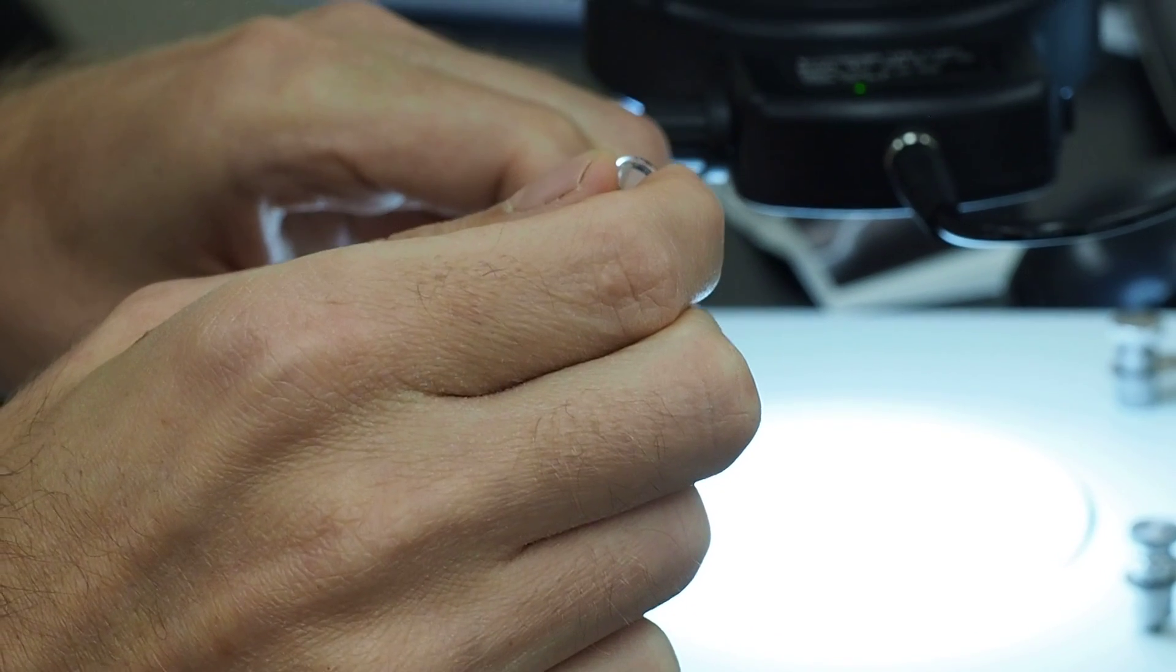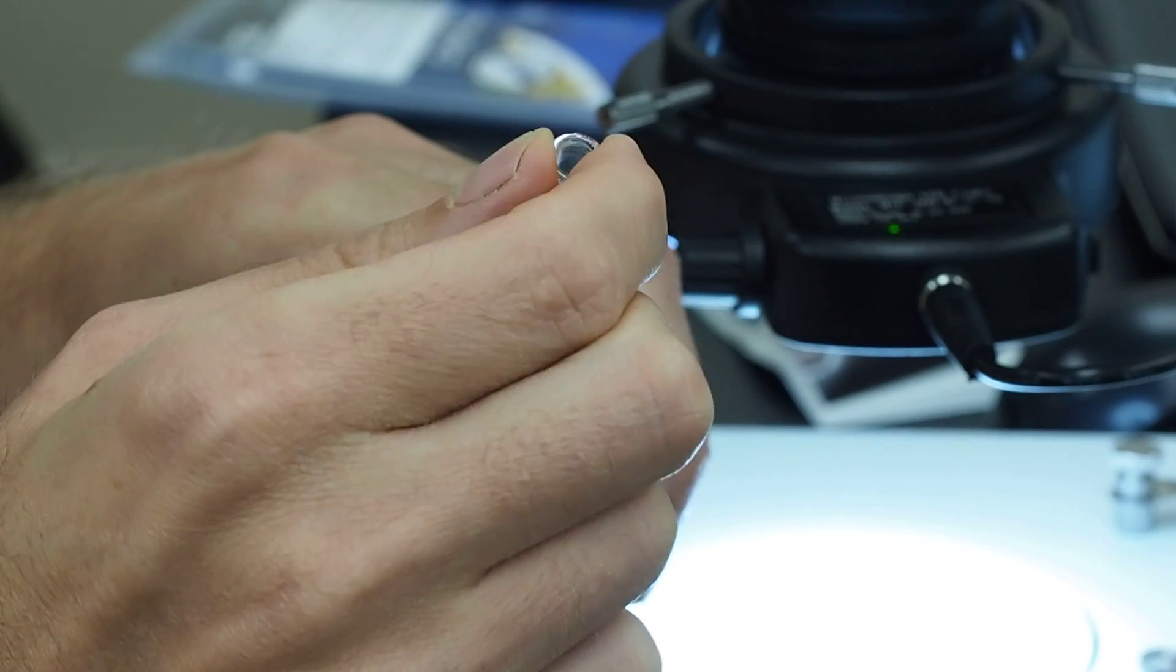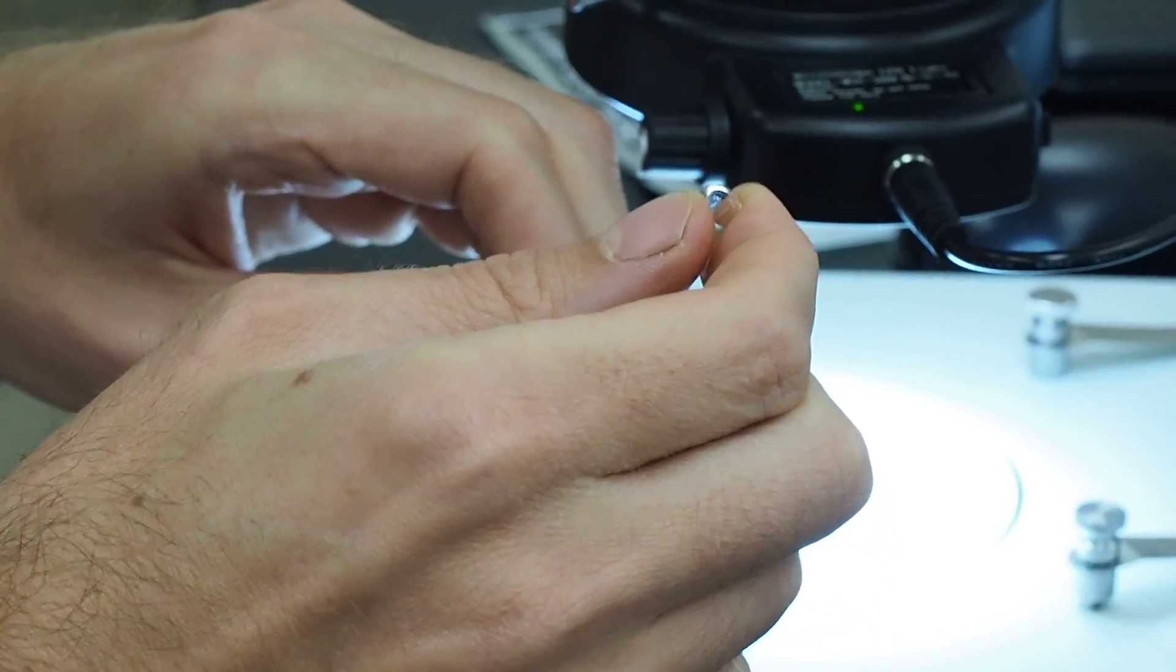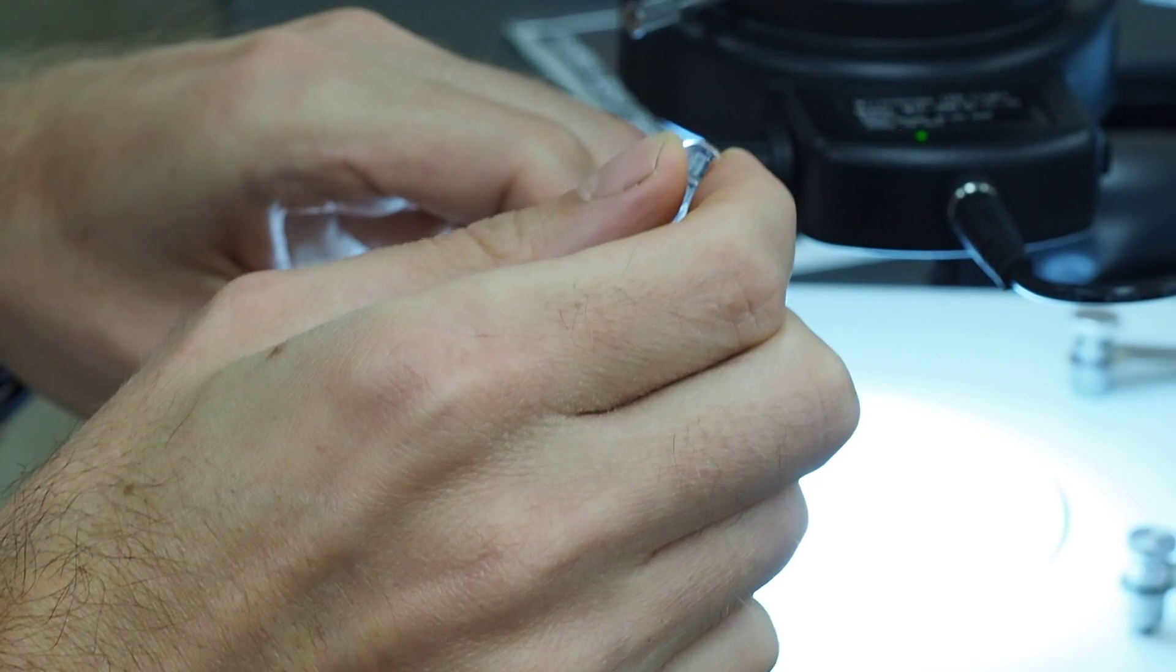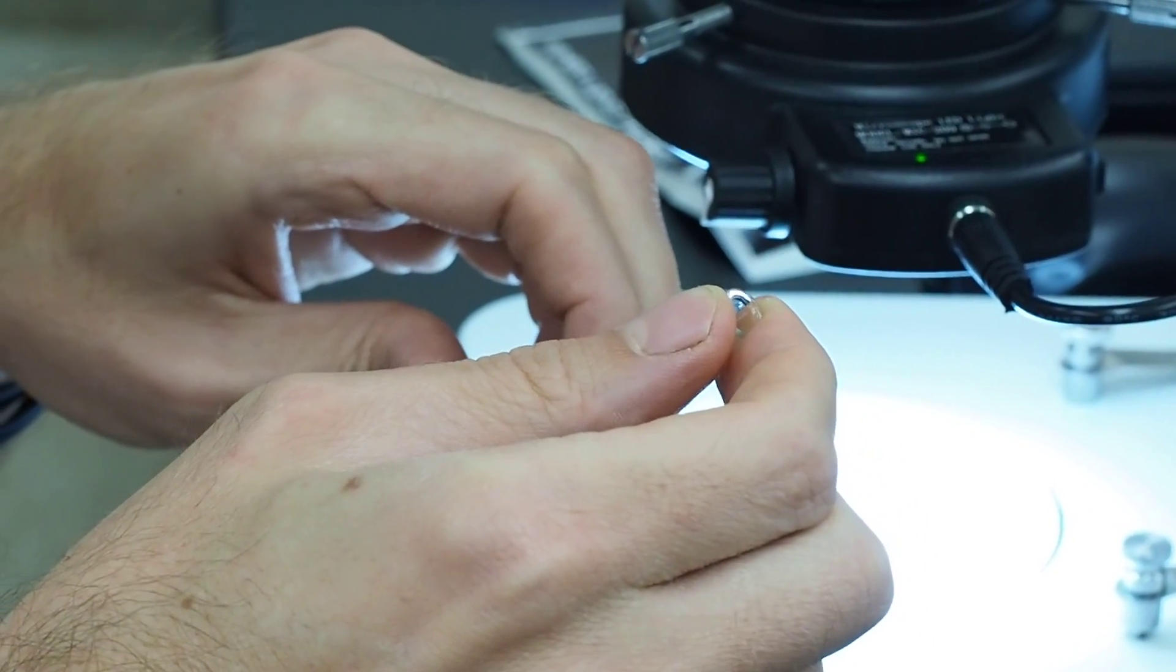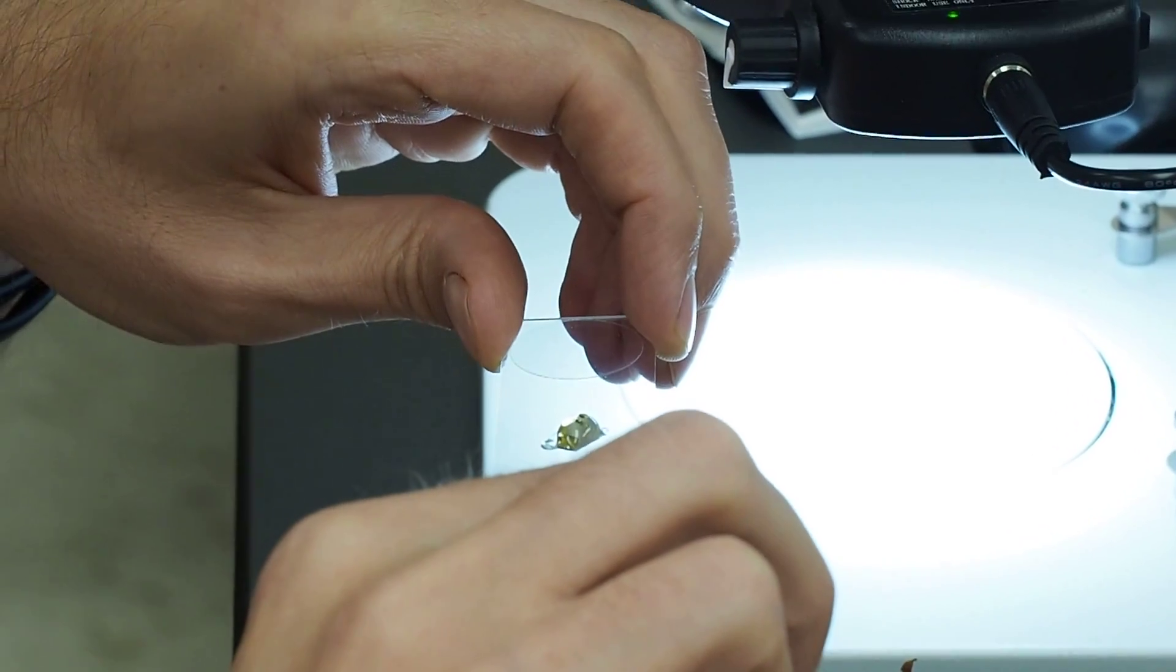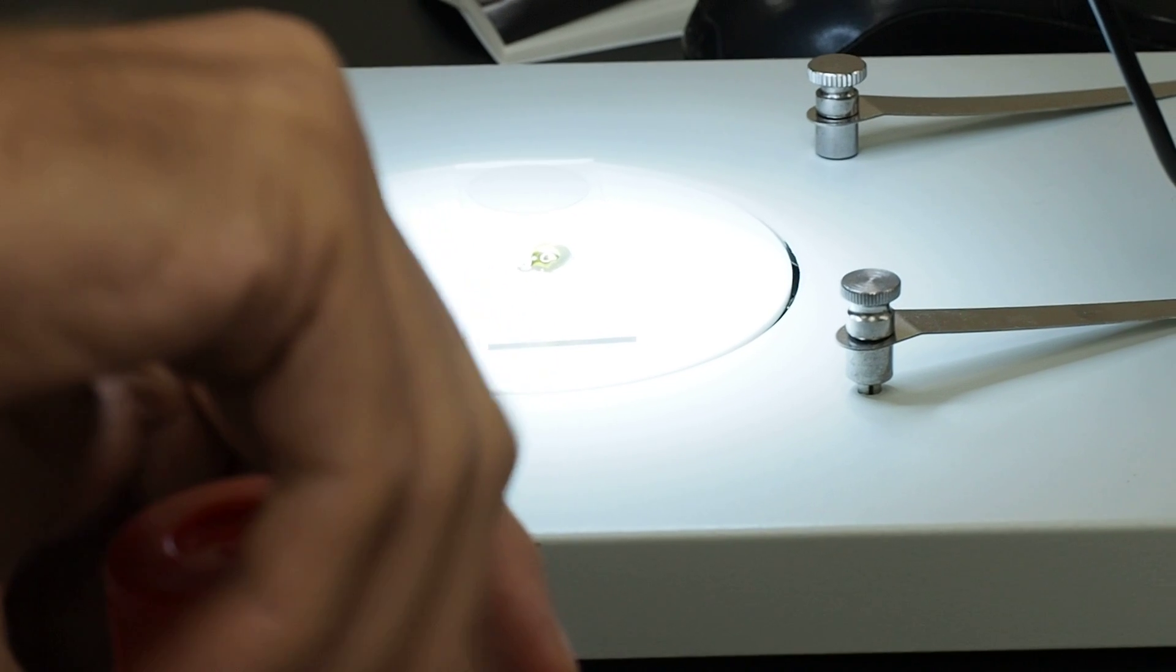Just kind of let it ball up. This probably needs some. People like to pre-add clove oil or xylene to their Canada balsam and that'll save you some time, but then all of your mounts will have the same degree of flexibility basically. So that's a big chunk of Canada balsam. Let's put that back in there, put it down, cap back on.